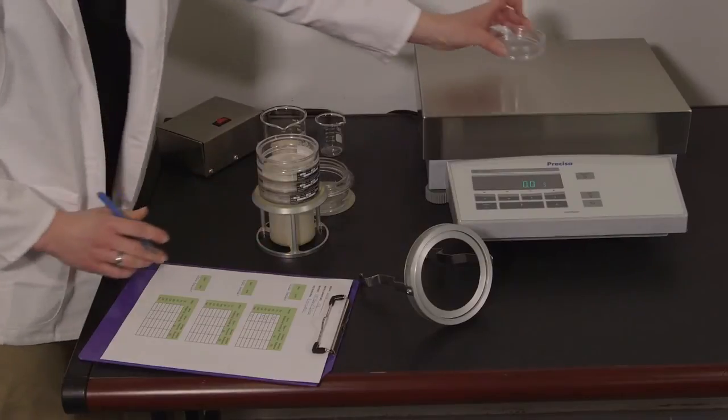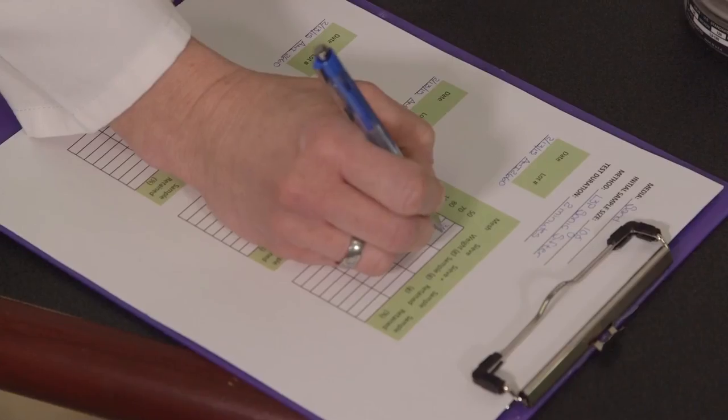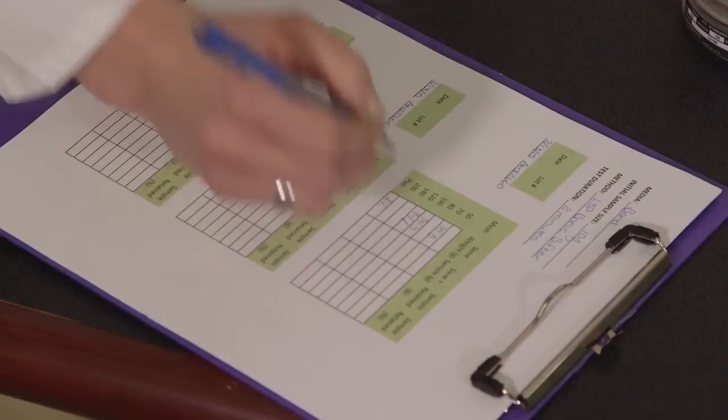Carefully remove the stack, disassemble, and re-weigh the components. Record and calculate your results.